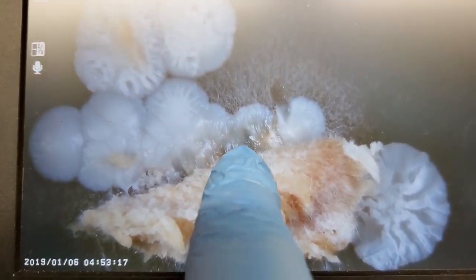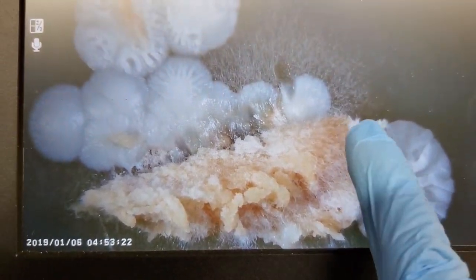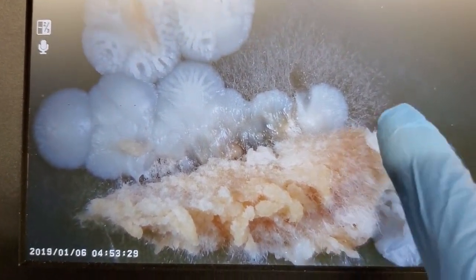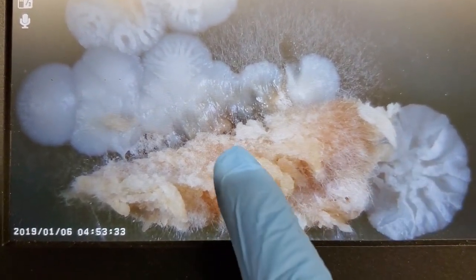I don't even think we're going to bother trying to salvage this one, just because it's so heavily contaminated. If you have this level of contamination, unless it's your only dish that you have any type of growth, I recommend just discarding this one. That's why we're using this one as an example.